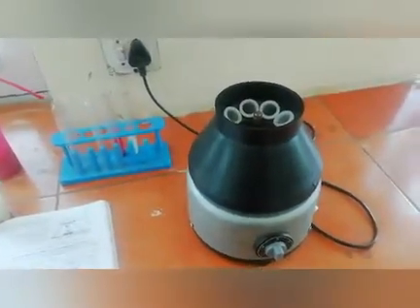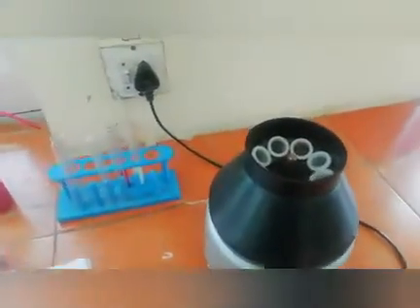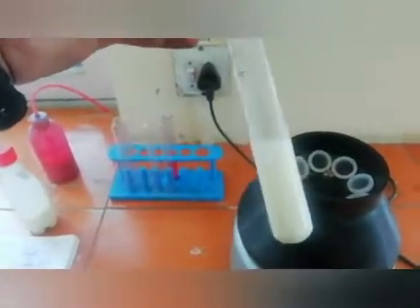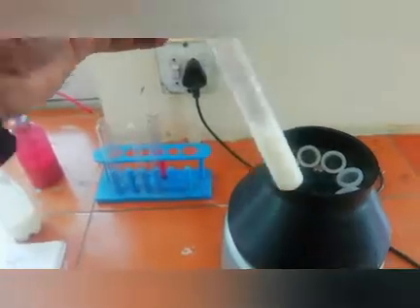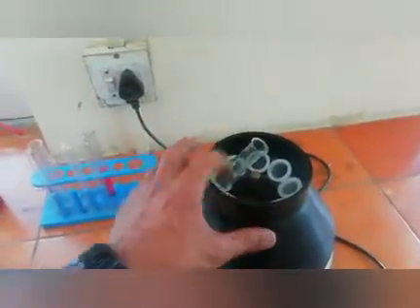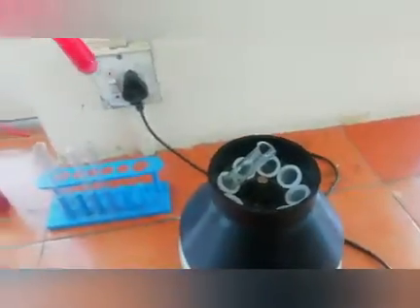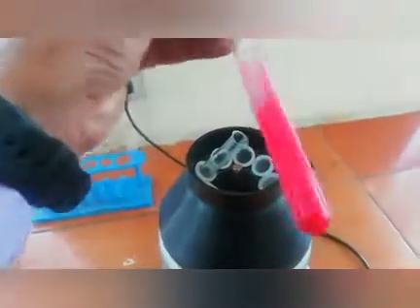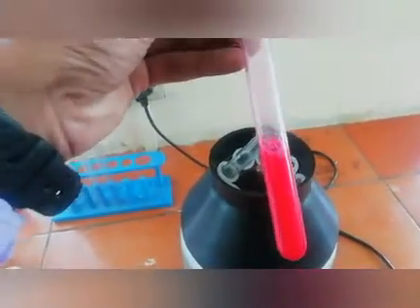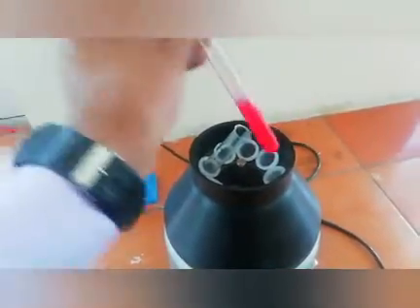So first we will prepare the mixtures that we have. We have two kinds of mixture. One, I have made curd, because from curd we need to make the cream. So I am putting this curd test tube in the centrifugation machine. And second, I have taken red color with some salt mixture, just to show blood. So let's take it as an example of blood.